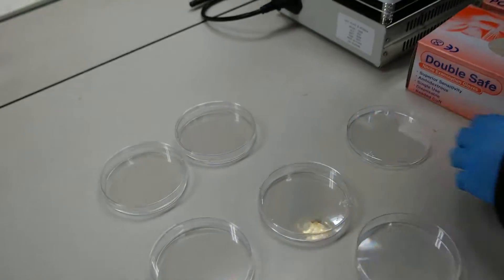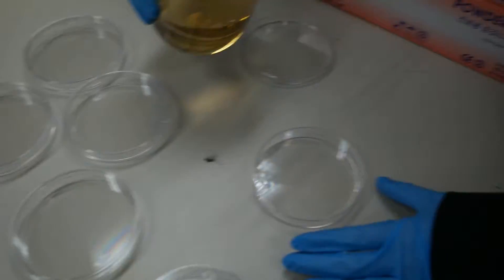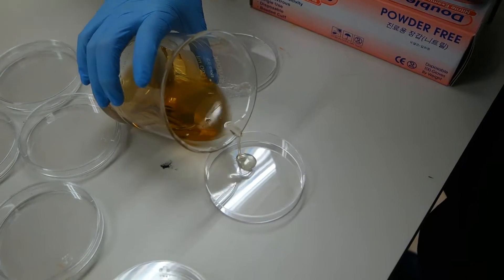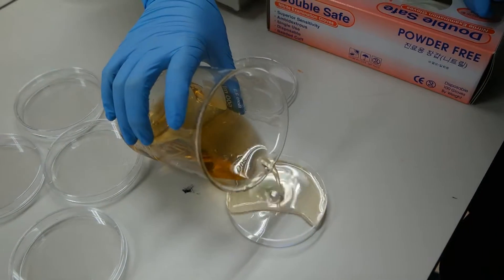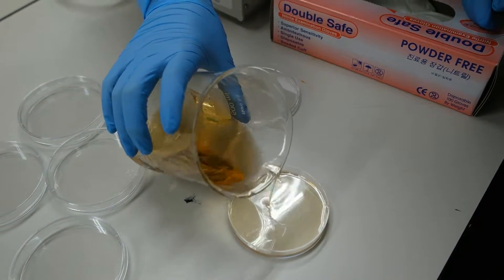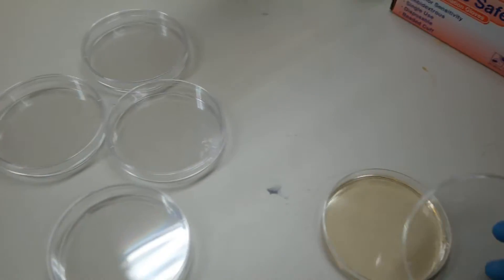Okay, so how much? Just pour it. It's like oil. It's jelly, jelly. What does it smell like?